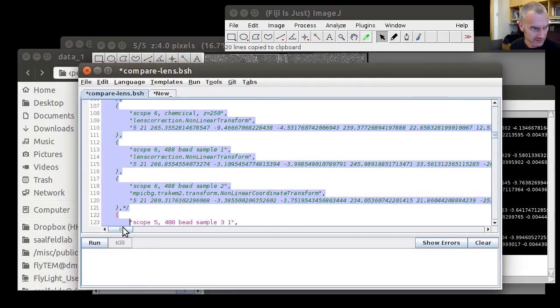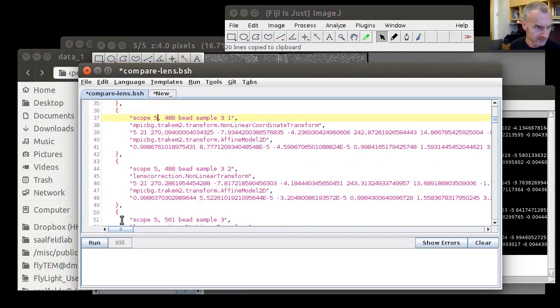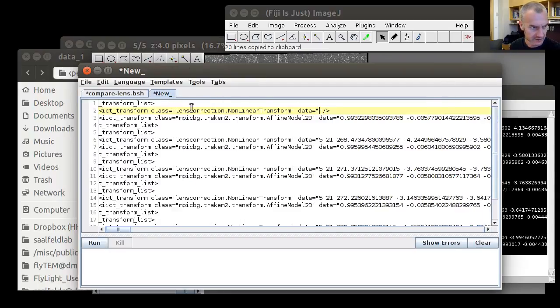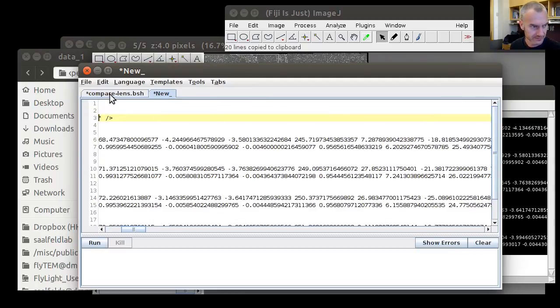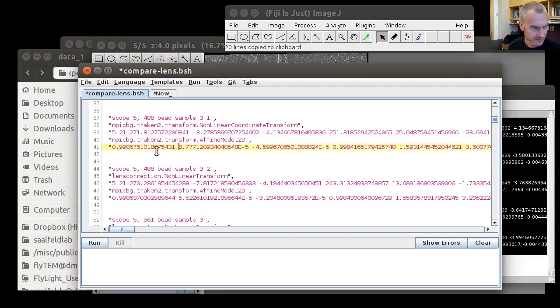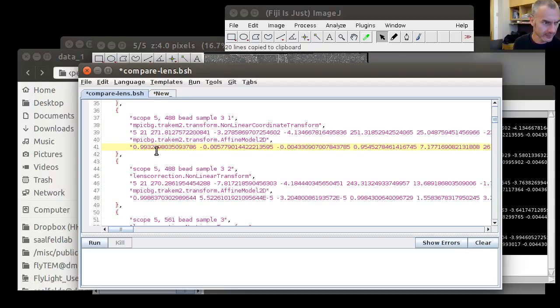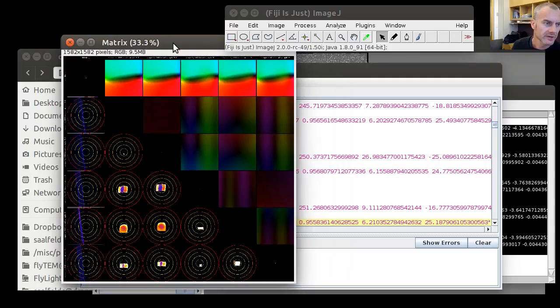That's all stuff that we don't care about right now. So this is the first model, and the affine part. The output of this script is a matrix display of this kind.